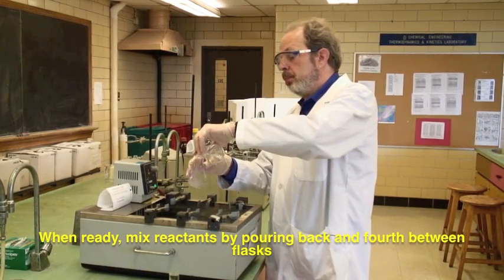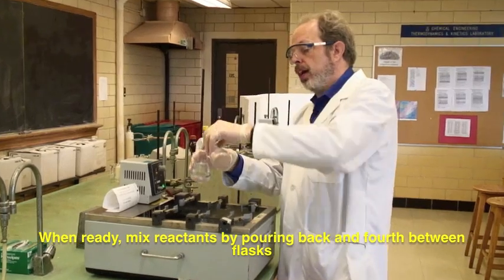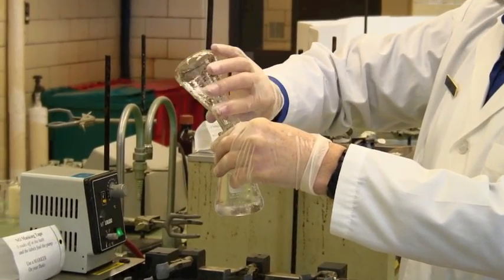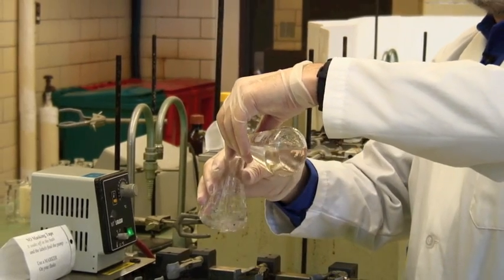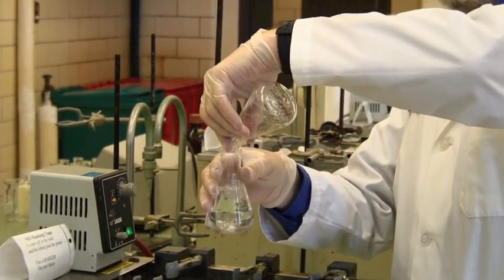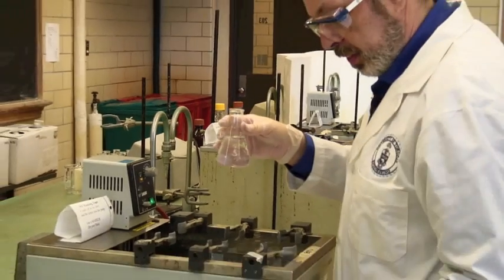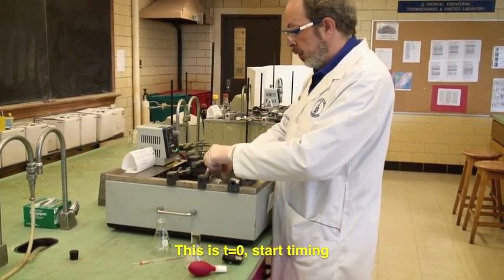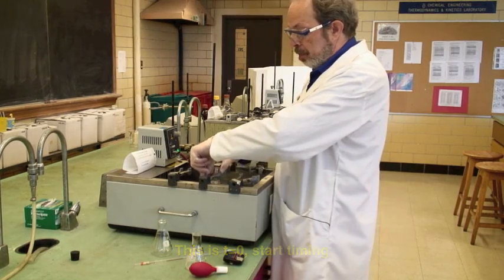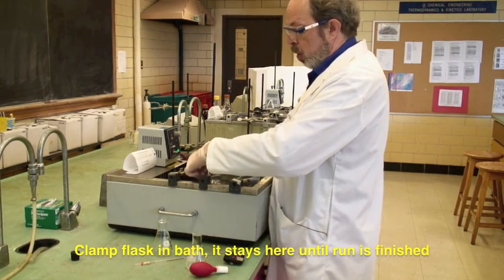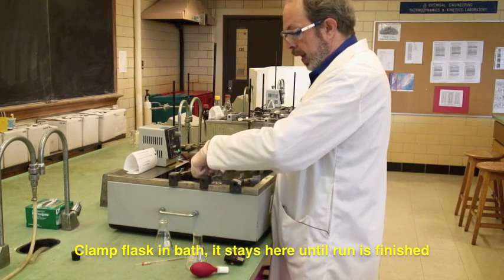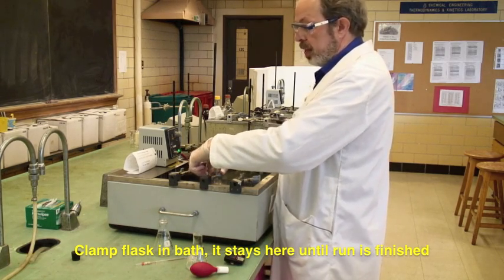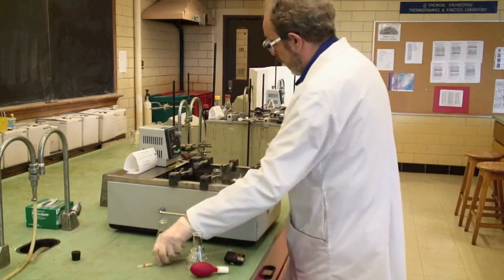You do this by pouring them between the 2 flasks. Do this 3 or 4 times, and you will now have a homogeneous reaction mixture. At this point, start your stopwatch so that we are now timing the reaction and put it back into one of the clamps. And this reaction mixture stays in this clamp at whatever the temperature of your bath is until the end of the reaction.